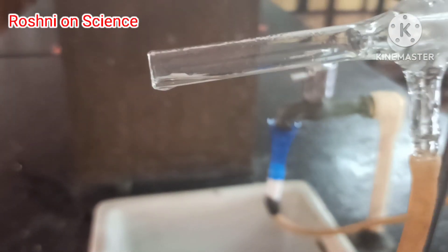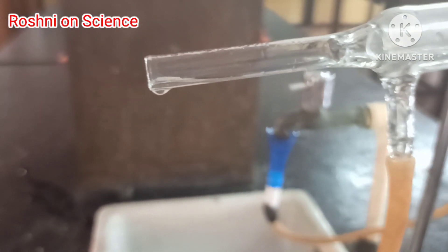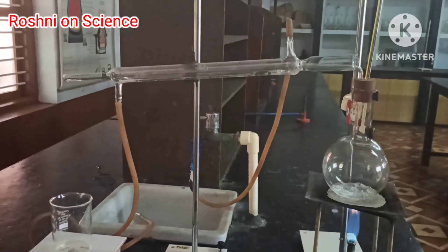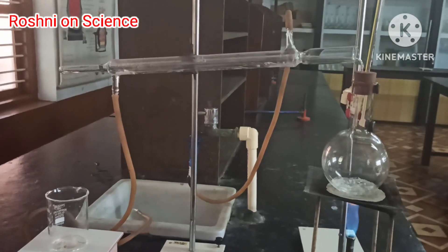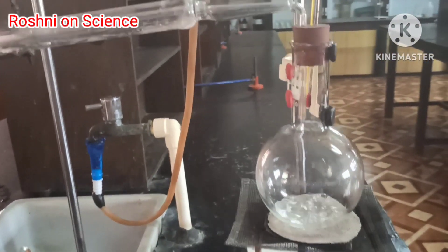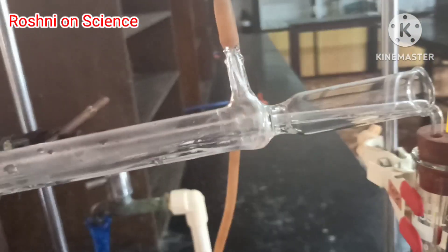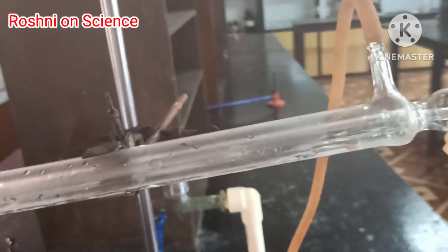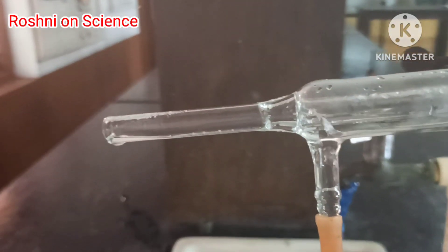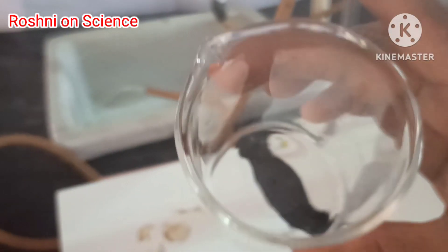Distillation is used for the separation of components of a mixture containing two miscible liquids that boil without decomposition and have a sufficient difference in their boiling points. By the process of distillation, we can separate acetone and water from their mixture.